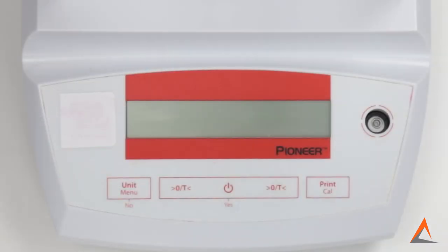To check the level of your electronic balance, you will need to consult the level indicator. The electronic balance is leveled when the air bubble is within the circle on the indicator and ideally when it is perfectly centered in the middle of the circle.